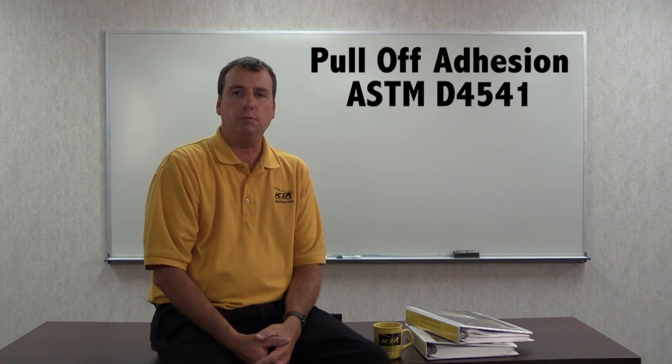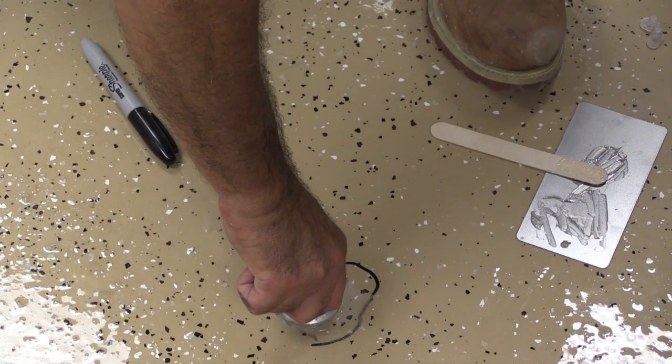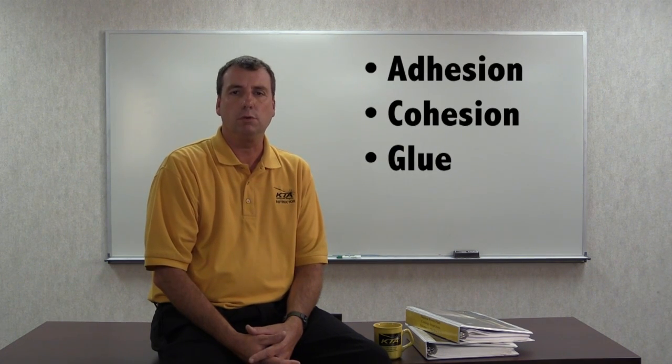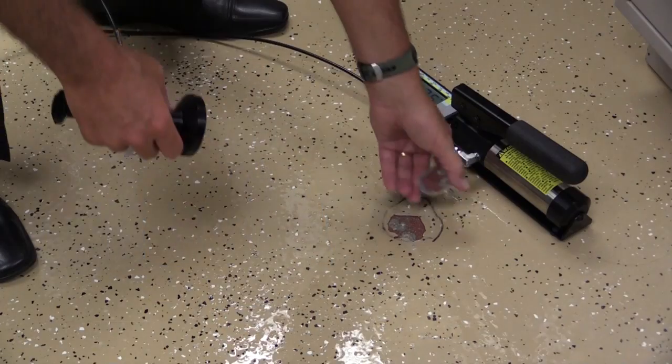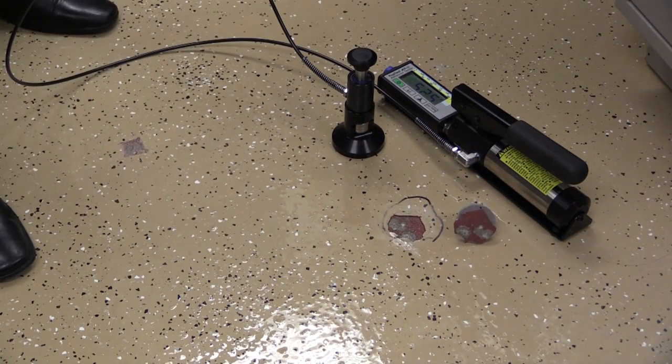Pull-off strength of coatings on steel is tested according to ASTM D4541. It requires the use of an instrument and the attachment of loading fixtures or pull stubs using an adhesive that may need to cure overnight, up to 24 hours. A pull-off value is reported in PSI or KPA, and the location of break is reported as adhesion, cohesion, or glue. The approximate percentage of each type of break is also reported when there is a combination of locations of break.